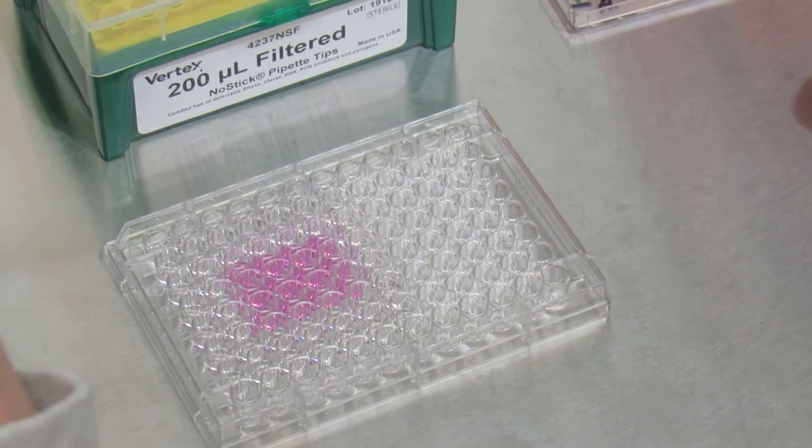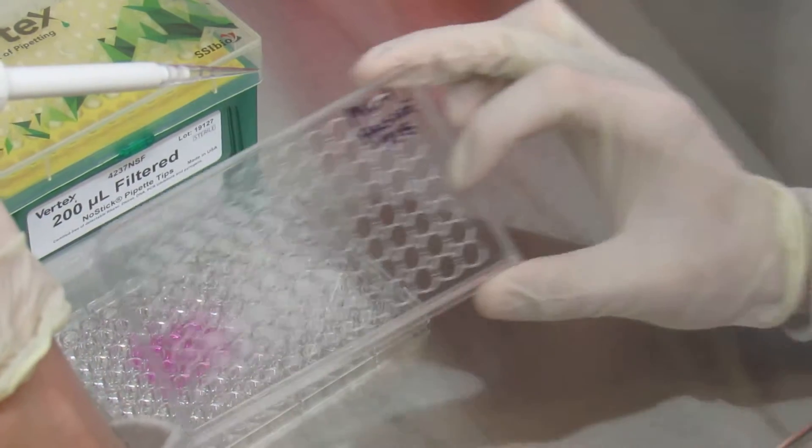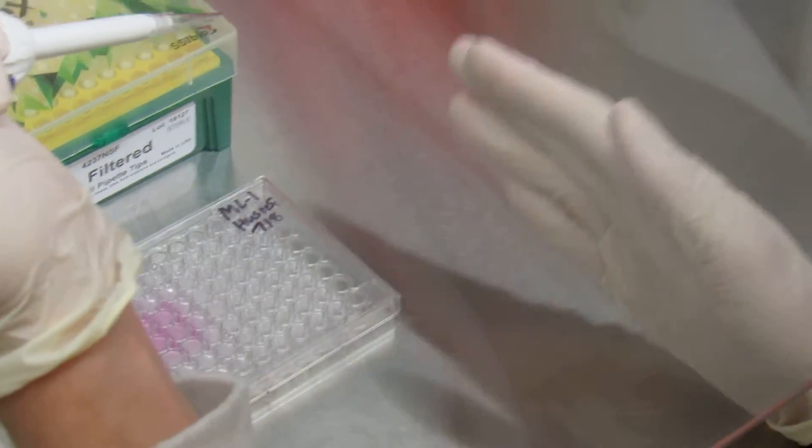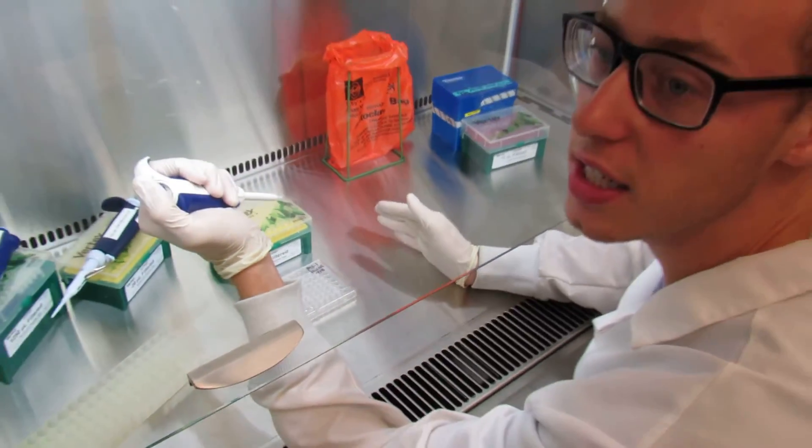And then you will change tips in between each well because they all have different concentrations of toxins and you don't want to transfer a different amount of toxin into another well.